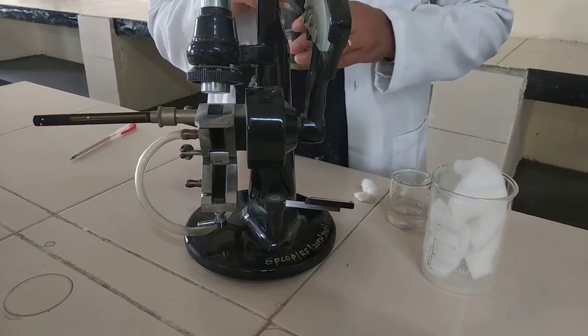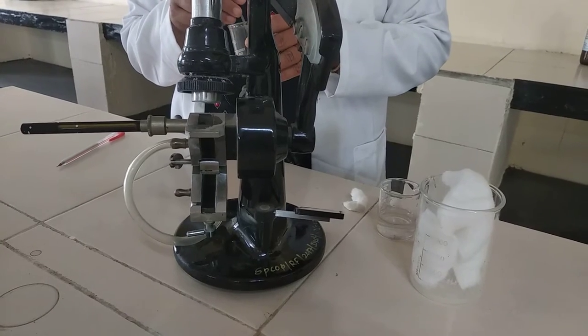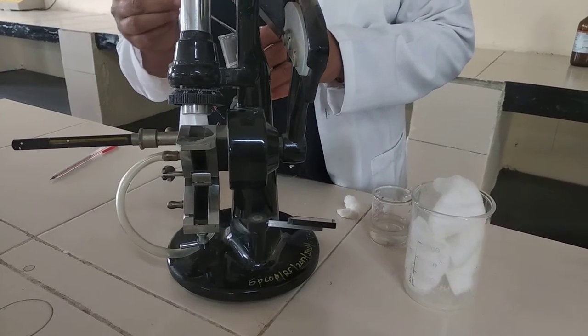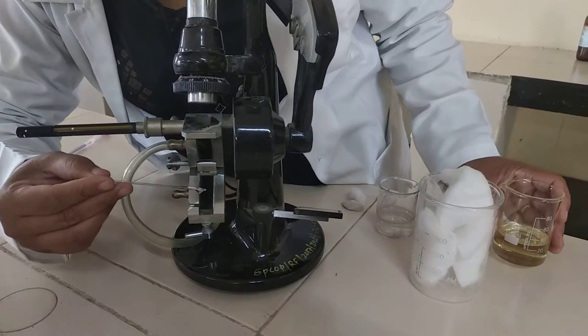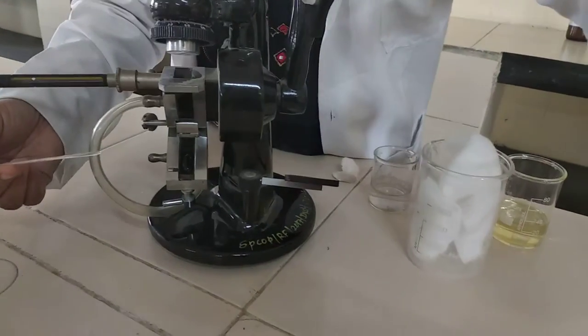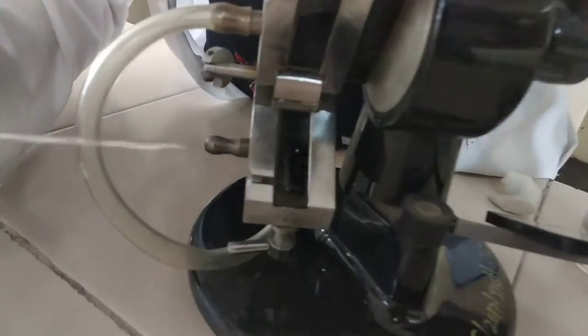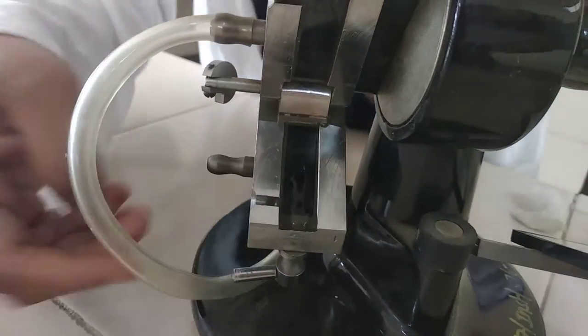Then the sample to be measured is introduced in between these two prisms. We have to apply sample drop on, like this in prism. Just, I have applied sample drop. Afterwards, we have to close this prism.